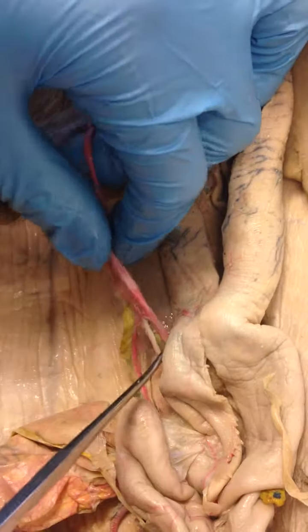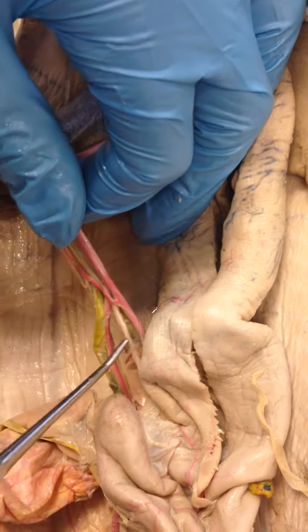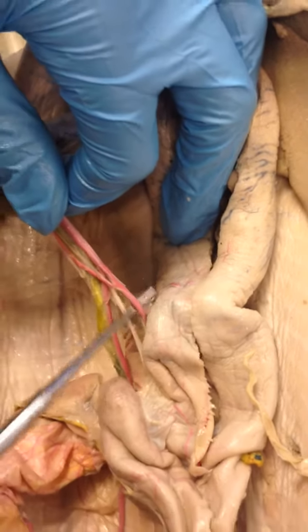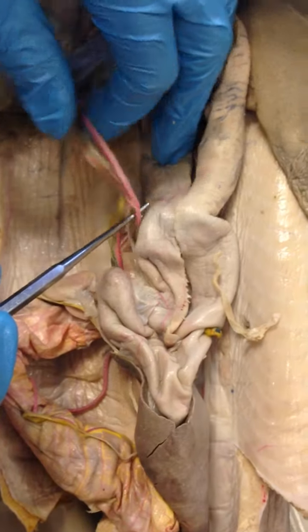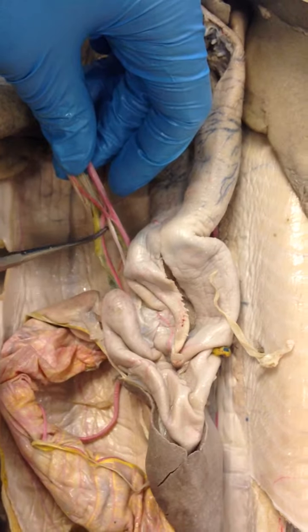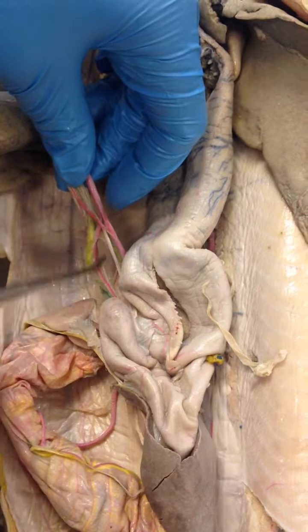Okay. So the next one is the gastric artery. The gastric artery itself is linked to the stomach, which is here. So this right here is the gastric artery. The one beside it, one also going down here, is the gastrohepatic artery. So this is the gastric hepatic artery.